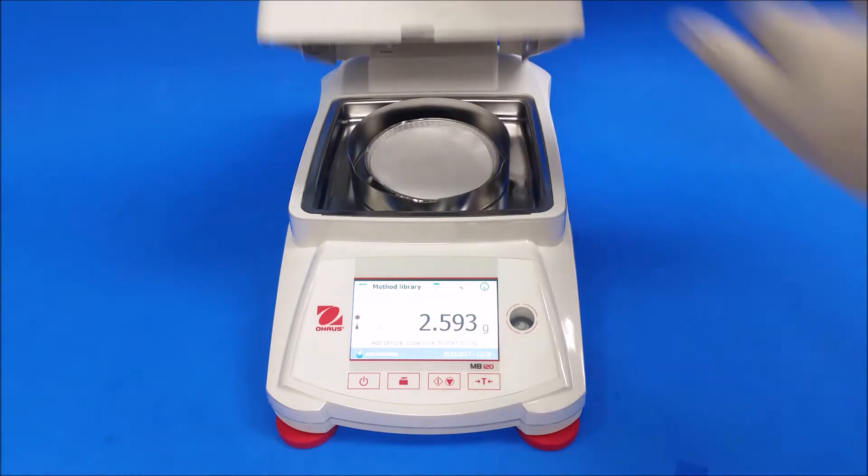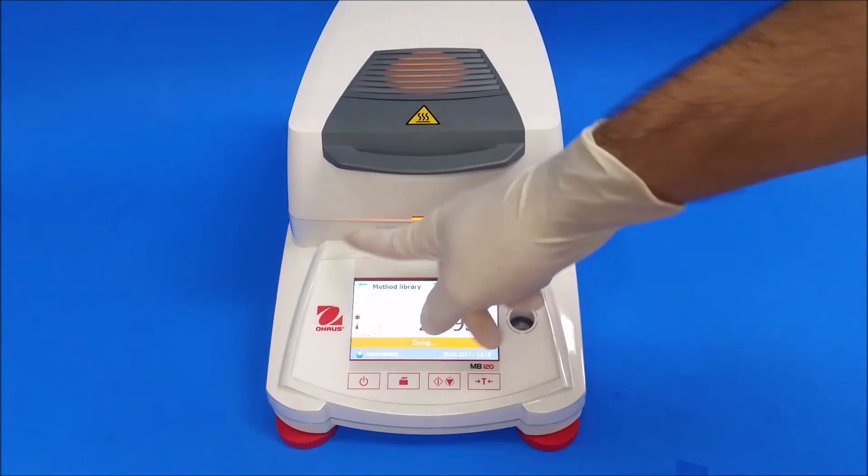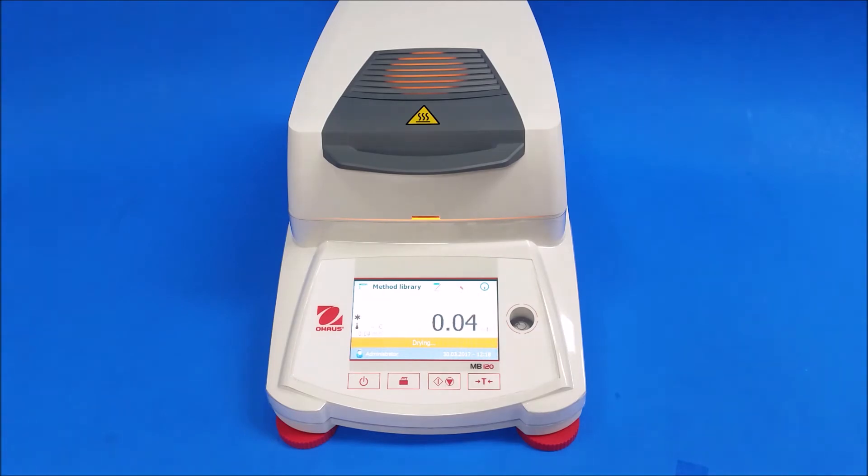That's good. You should start seeing the lights turn on here and here. That means it's starting to heat up.